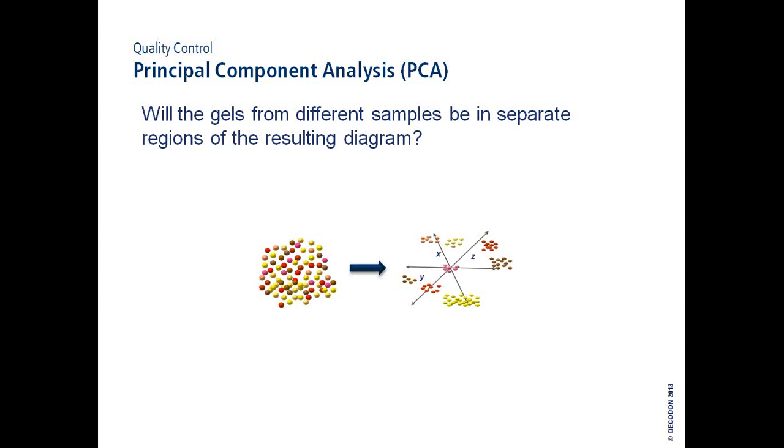then depending upon their similarity they are grouped together, or in other words, we find a projection in this data space where all this data is as neighbored as possible, where the distances are very small, where the variation is very small. And if it's resulting like this, where all the different image data is nicely separated so that the replicates are separate groups here, then everything is fine. And then you can see outliers easily, for example, if a red spot would be in this yellow group.